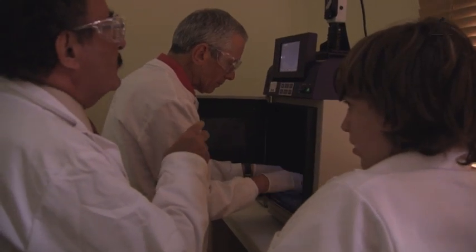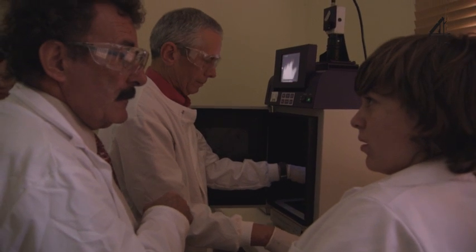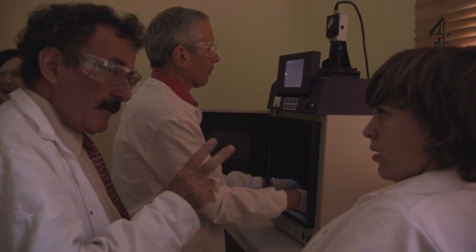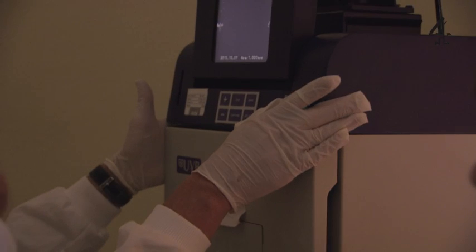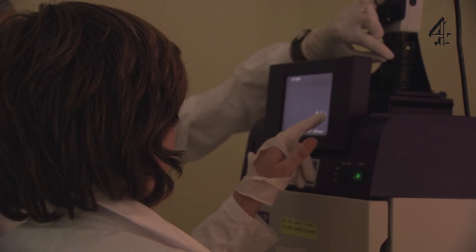Now, Jenny, I want you to tell me who the innocent person is from this gel. How am I meant to know? Because there were two DNA samples at the crime scene — one's a murderer and one's a victim. So I want you to tell me, looking at the gels, who the innocent person is. Is the innocent person the one with all of it? Good girl. Why is that, though? Because those two have got the same DNA. So that's one person.